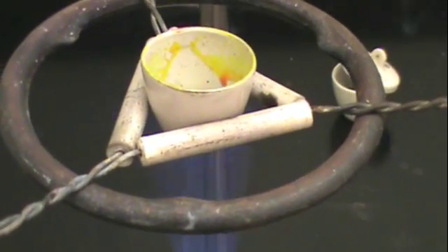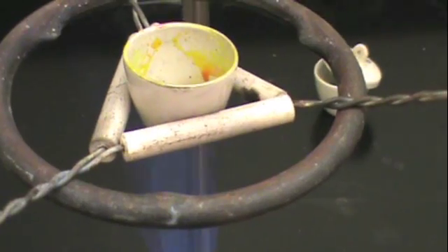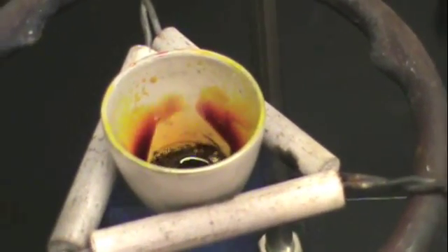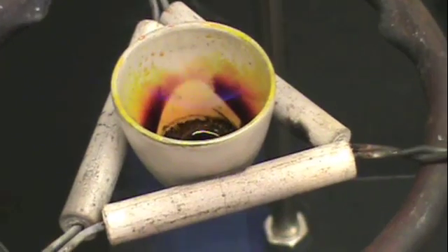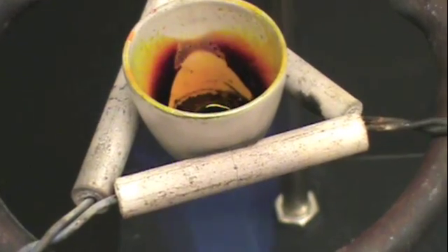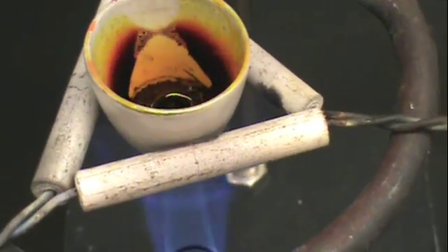The other option is to place your crucible in a triangle directly into the flame. You will want your crucible pretty close to your flame so that you generate enough heat to remove the excess sulfur. Again, you want to make sure your lid is off while you do this so that you do not cause any explosions.